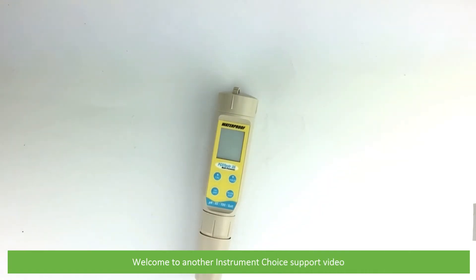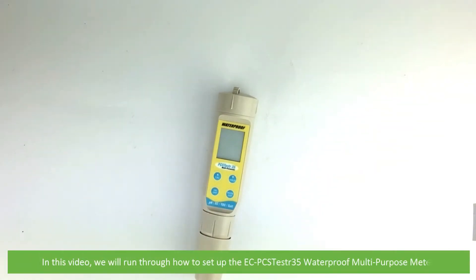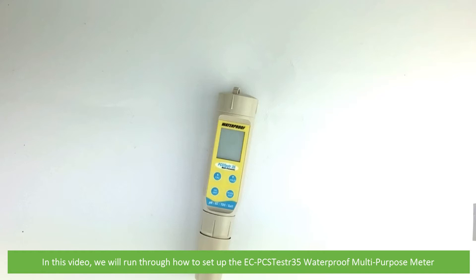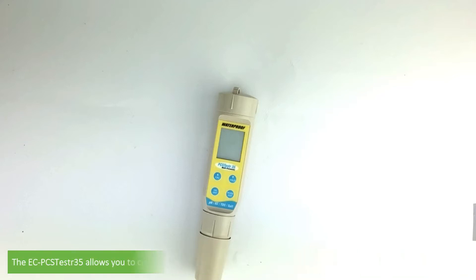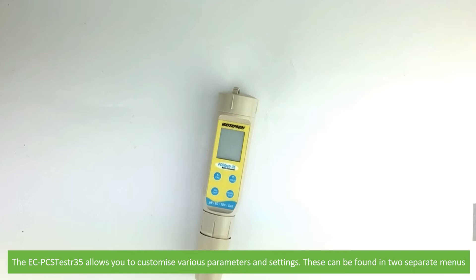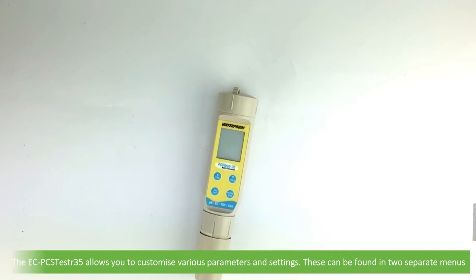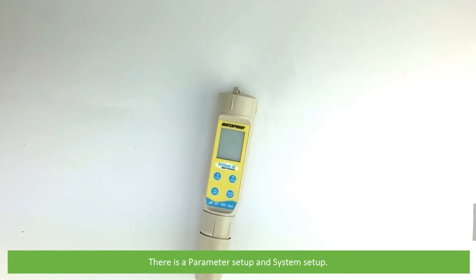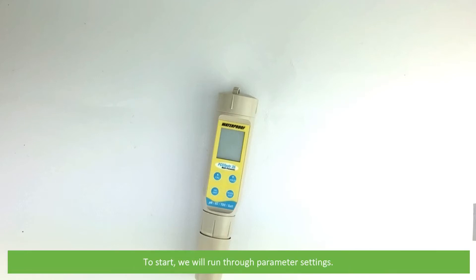Hi and welcome to another Instrument Choice support video. In this video we'll run through how to set up the EC PCS Tester 35 waterproof multipurpose meter. The EC PCS Tester 35 allows you to customize various parameters and settings, found in two separate menus: a parameter setup and a system setup. To start, we'll run through the parameter settings.